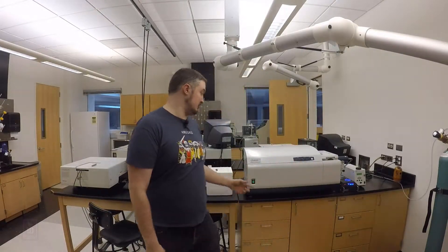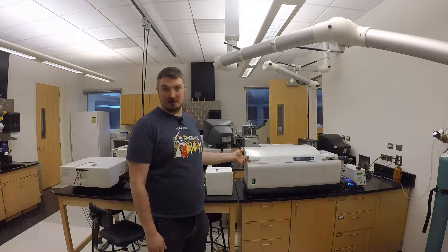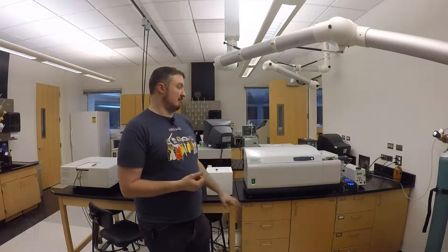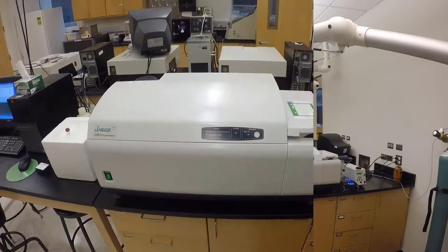Hi folks, today we're going to talk about how to operate and use the JASCO J815 Circular Dichroism Spectrometer. This is an instrument that allows us to study different chiral molecules, of which proteins are a major representative, especially in the secondary and tertiary structures where alpha helices have a specific handedness. We're going to walk through how to work this thing and what kinds of things it can do for you in your research and in class.